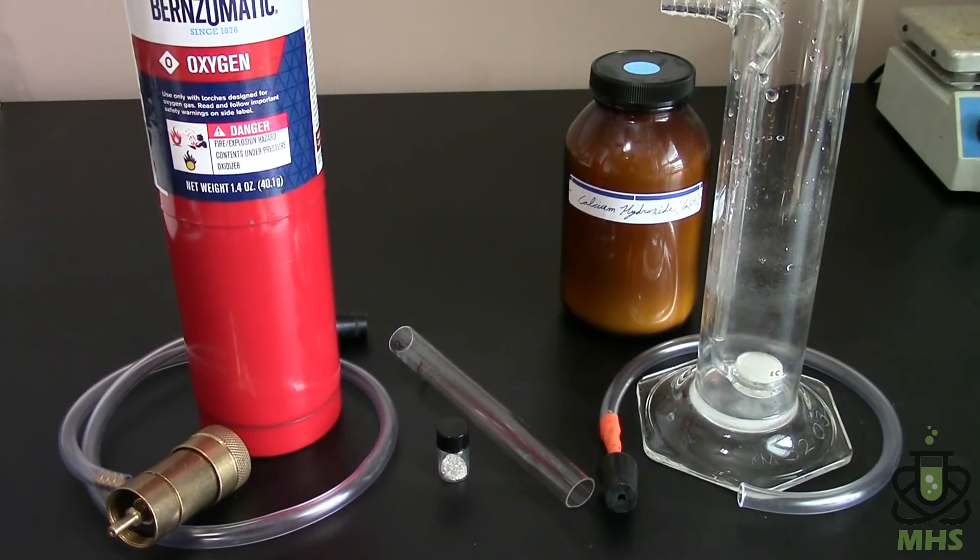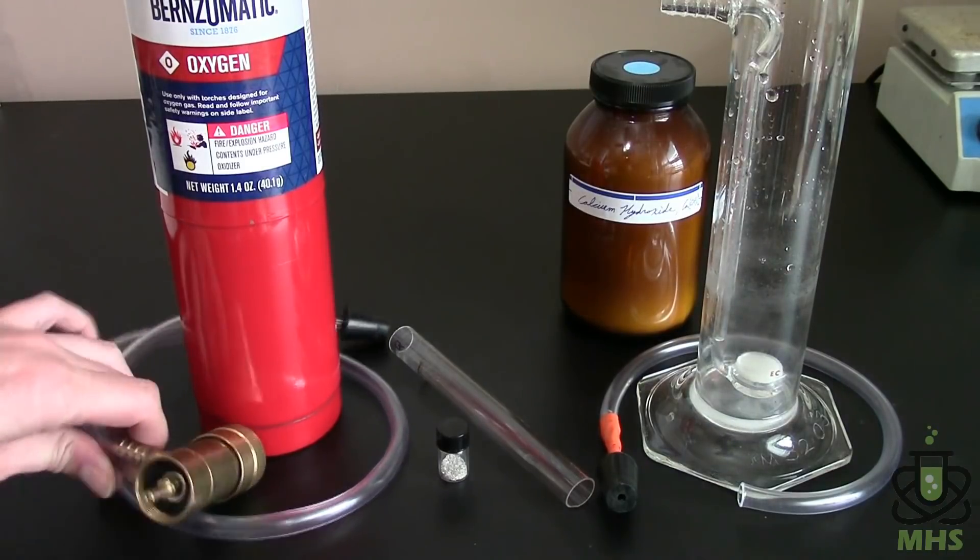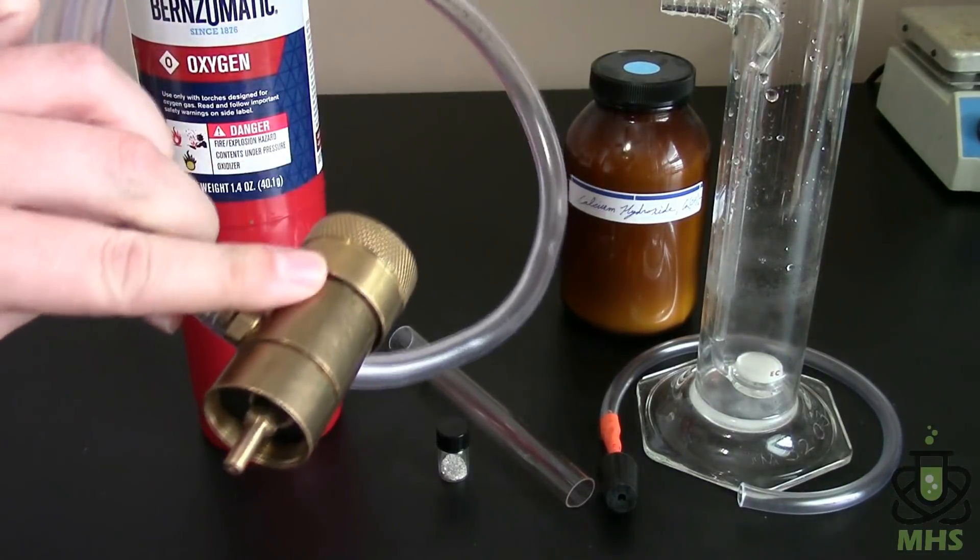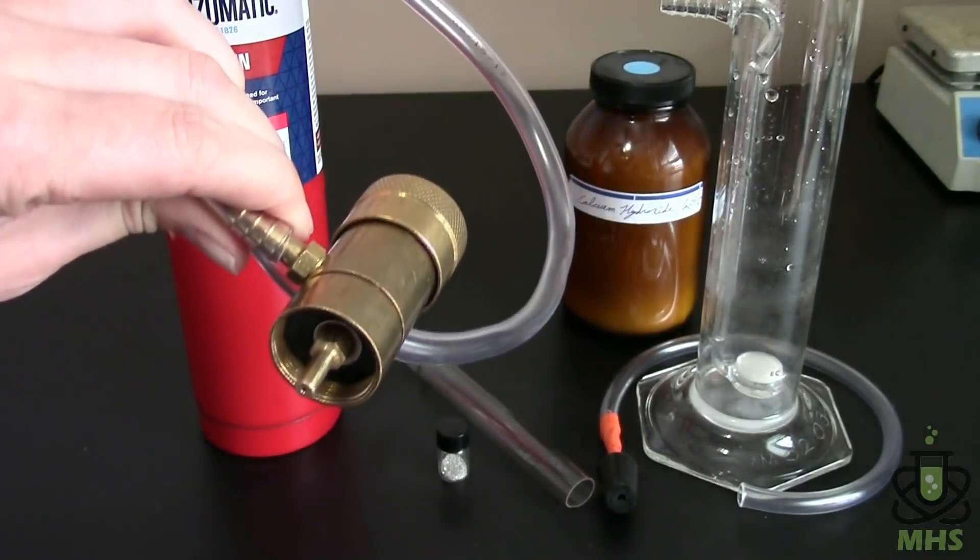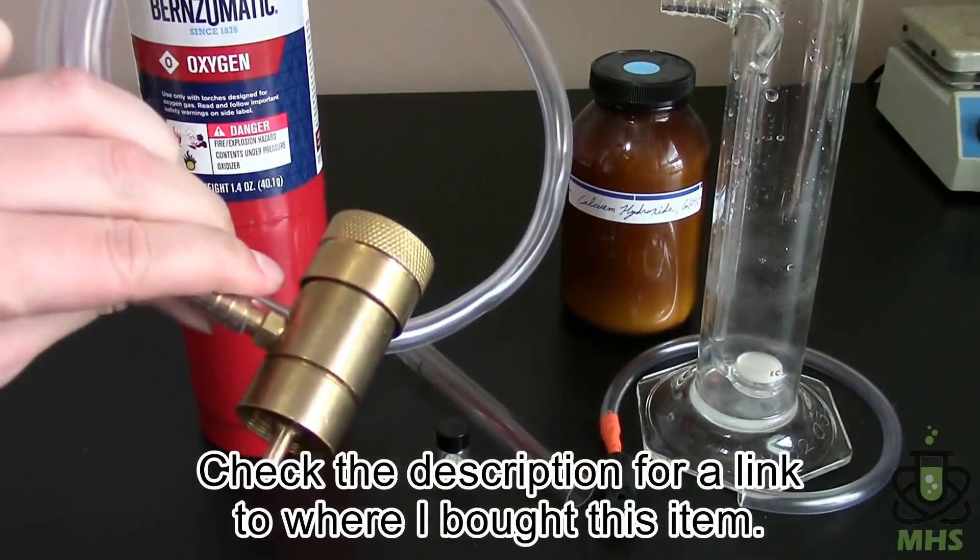Makes it inconvenient for me though. So I had to go online and after a lot of searching I found this little oxygen regulator that screws right onto the top of the cylinder.